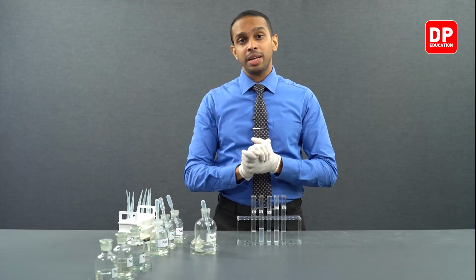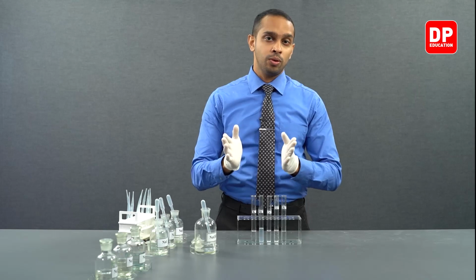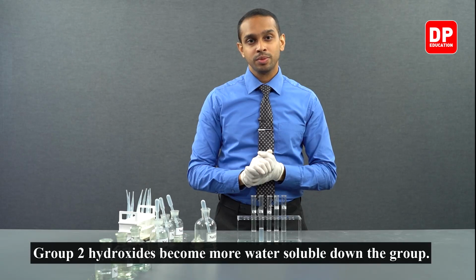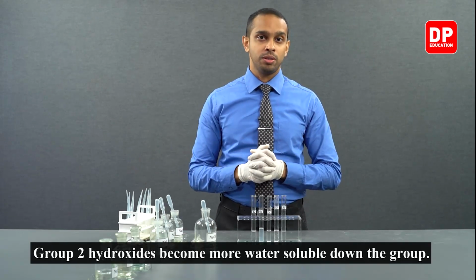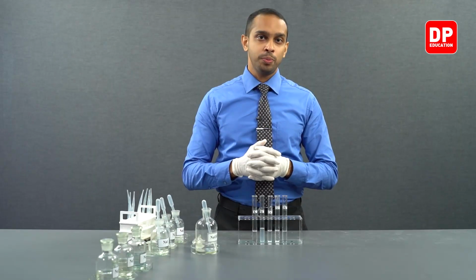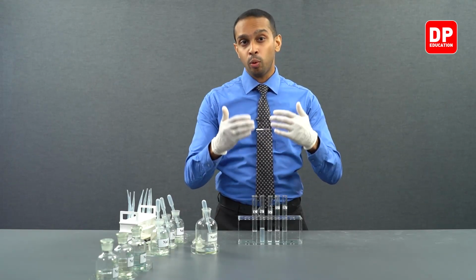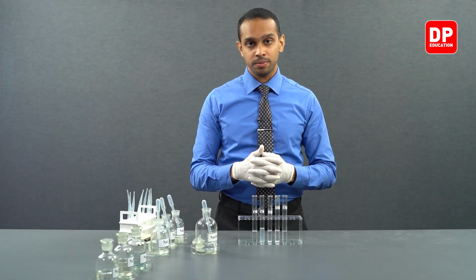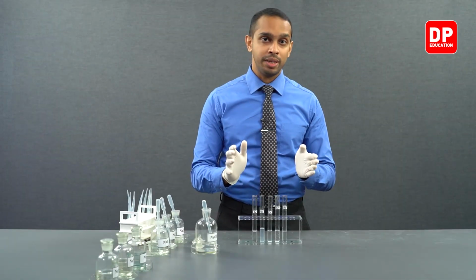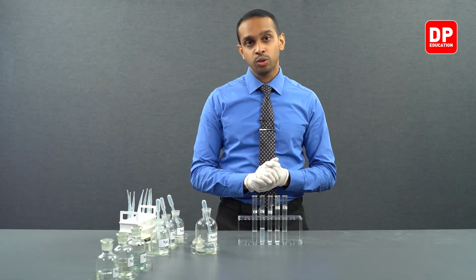So, when barium 2 plus ions come into contact with OH minus ions, or hydroxide ions, they form barium hydroxide, which is soluble in water. This indicates that when you're going down the group, group 2 hydroxides are becoming more and more soluble in water. Now let's move on to see a small summary of how the cations we have here reacted with sodium hydroxide.